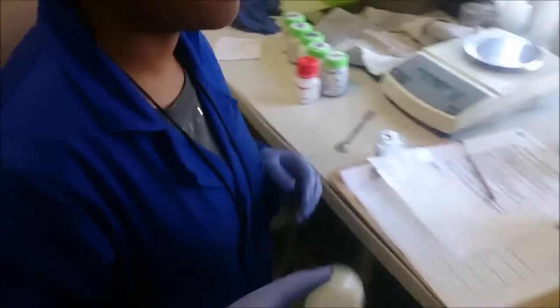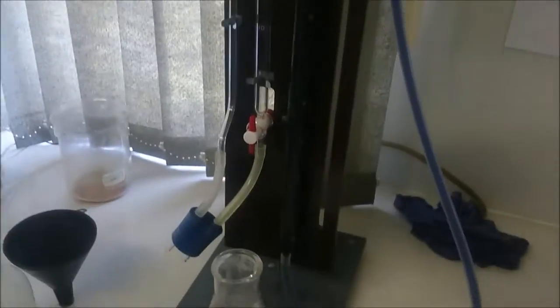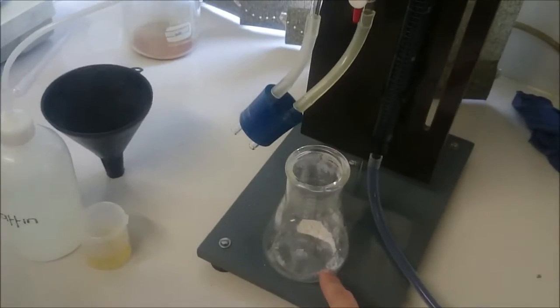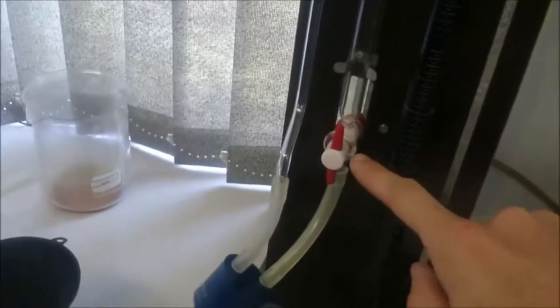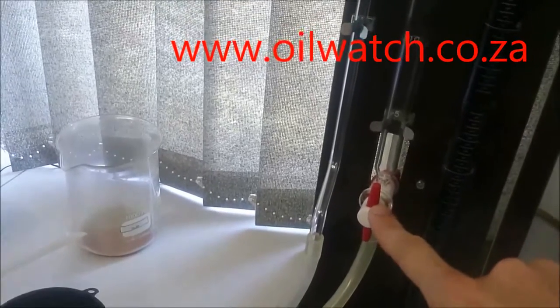Shake the mixture. We're about to start our test. We've got our 0.4 grams of calcium hydride. Our water tap is on three and our sample tap is open.